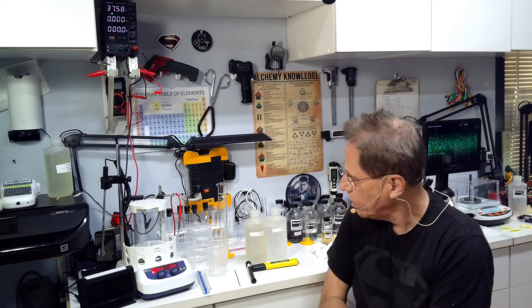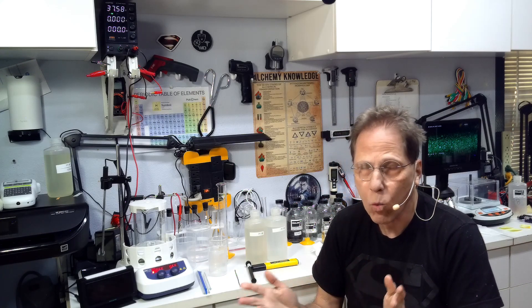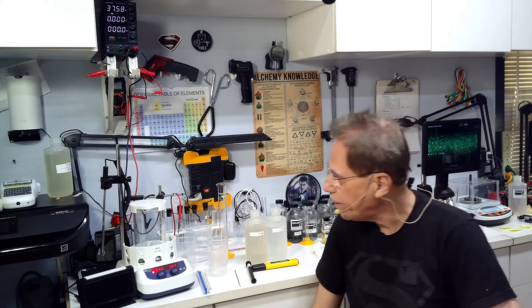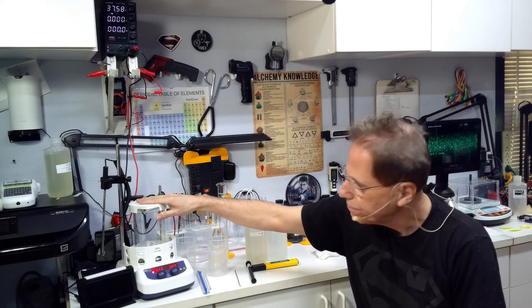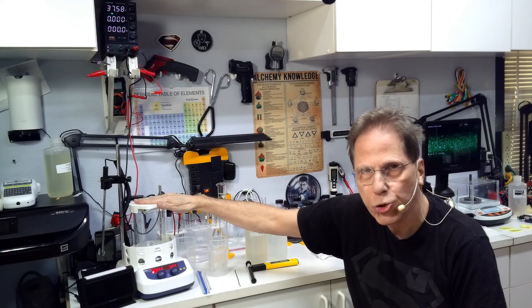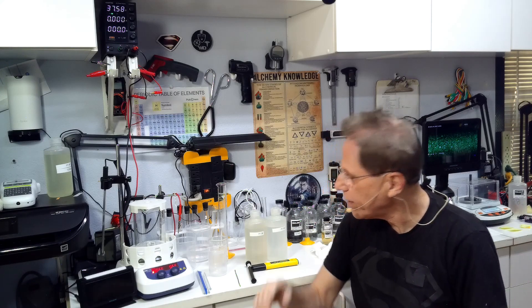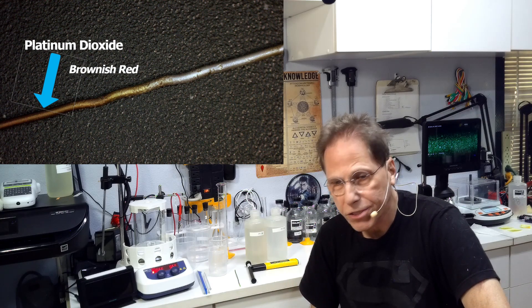We're going to be making the light smoky or clear version of platinum. You're going to be able to cook anywhere from three, well from one to eight parts per million. My goal in this one is anywhere between five and six parts per million for this particular trial. Now the problem with cooking it longer is a couple things happen here: the solution becomes saturated and we're not sure why, and no more platinum will go into the solution.